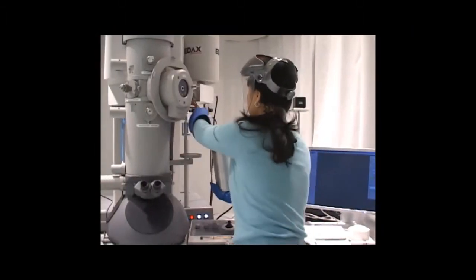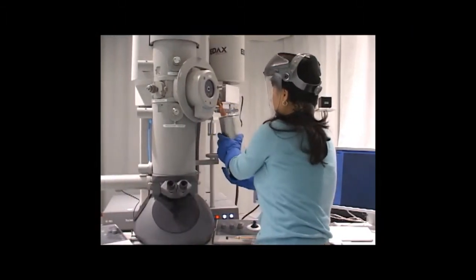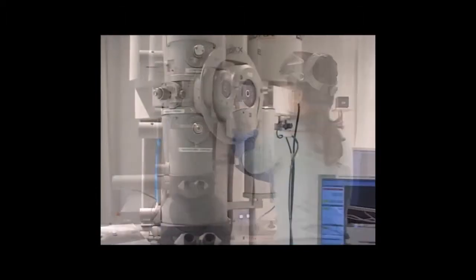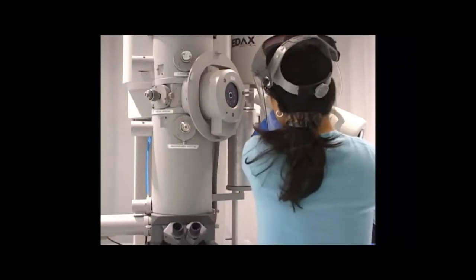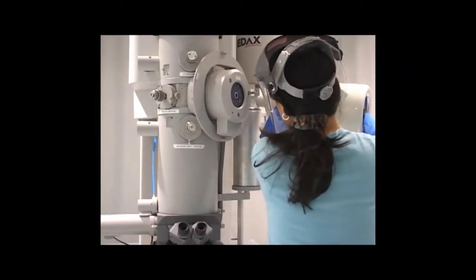Place the copper cold fingers slowly into a dewar of liquid nitrogen. Top off the dewar with additional liquid nitrogen. This will keep the sample cold.